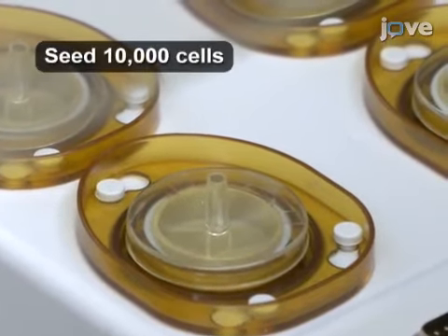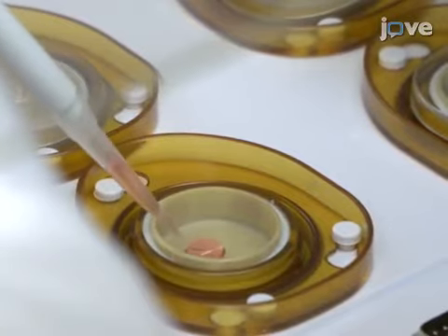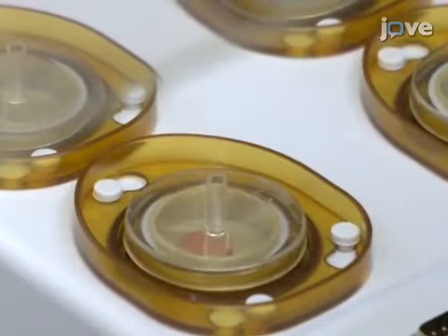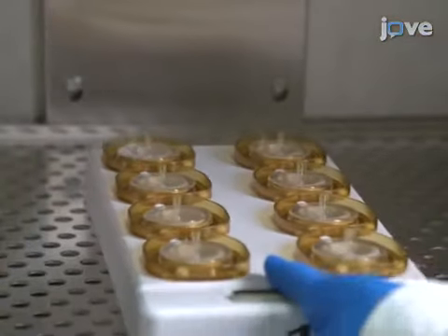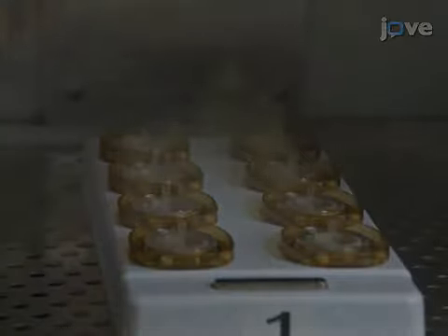Pipette 200 microliters of the cell suspension onto each cover slip, such that a drop is formed on its surface, and cover the dishes with their lids. Incubate all dishes at 37 degrees Celsius, 5% carbon dioxide overnight to allow the cells to adhere.